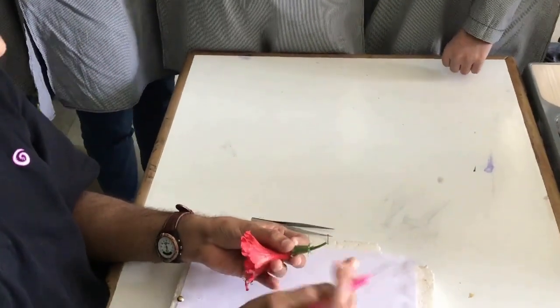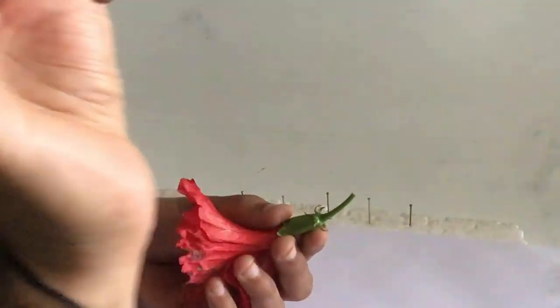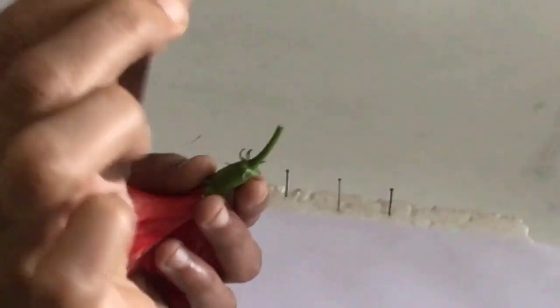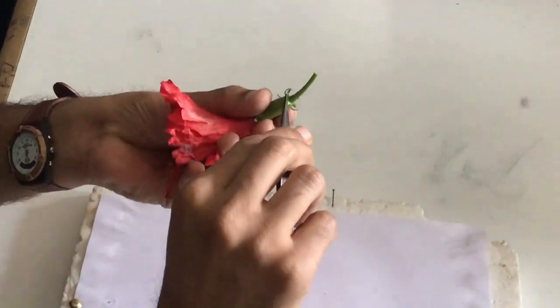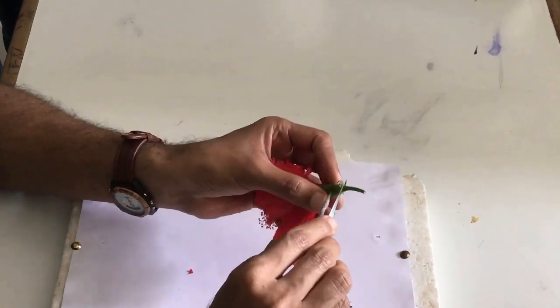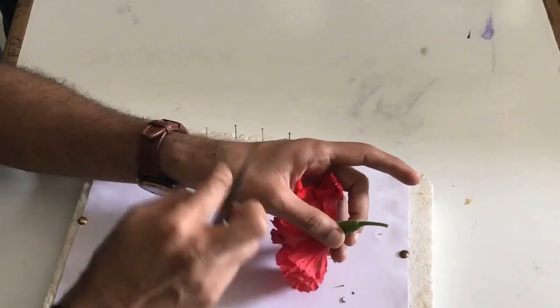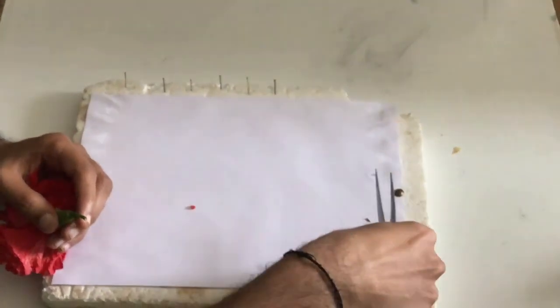We will remove the outermost whorl first, then go inside. To remove it I will use forceps — this instrument used to pluck is called forceps. These are also called office pins. So take your forceps and remove the parts. This flower at the bottom can get very sticky because of nectar or fluid present. I will keep the parts on the side, arranged in a particular order.